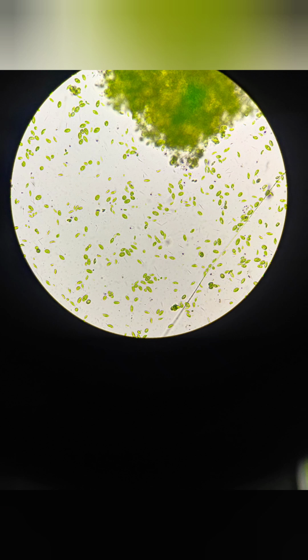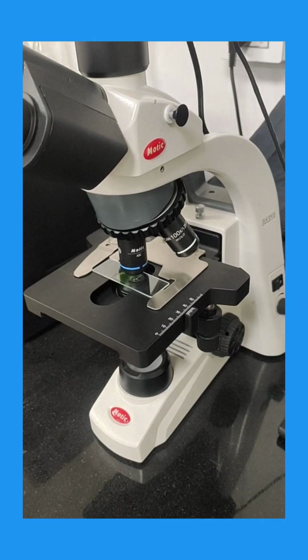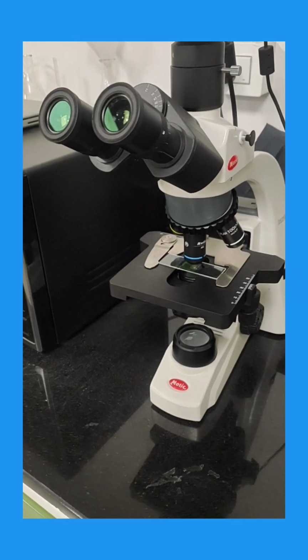In this video, I'm going to demonstrate how to use a compound light microscope along with its camera. This compound light microscope is of Motic company. I'm making this video because when I was going to use the camera microscope for the first time, I could not find any video on YouTube for this particular company. So let us begin.